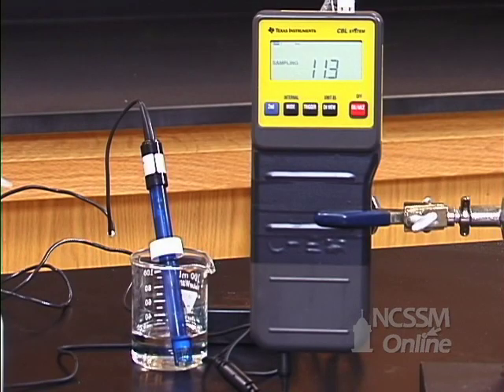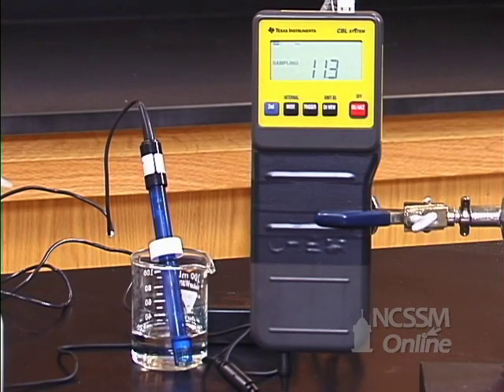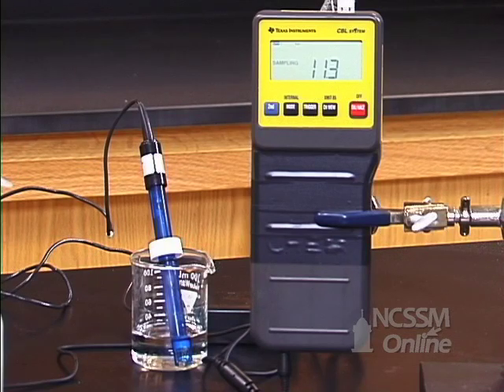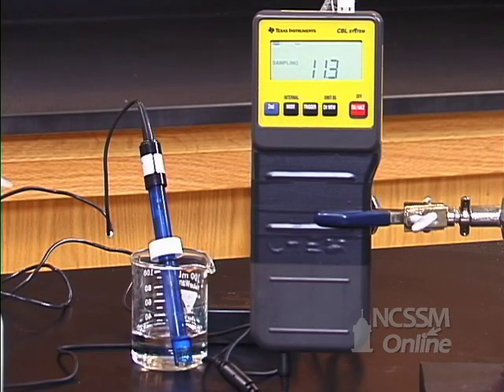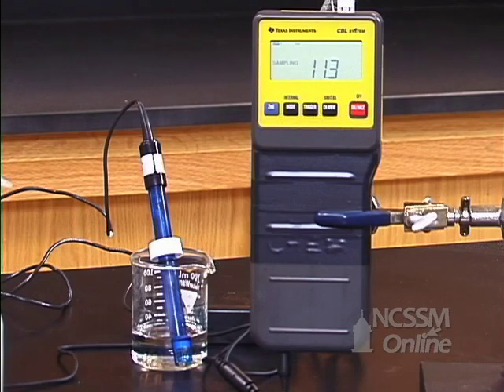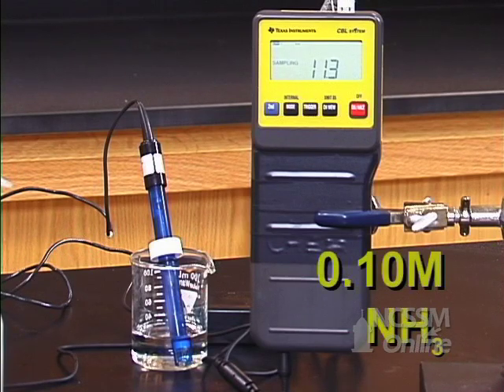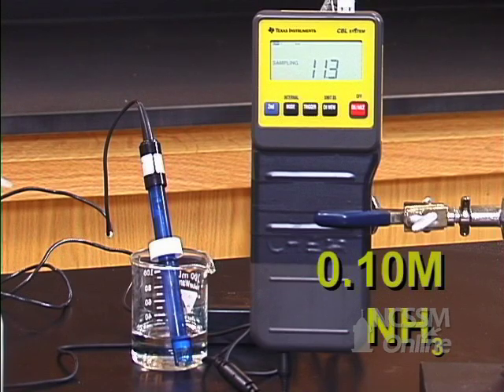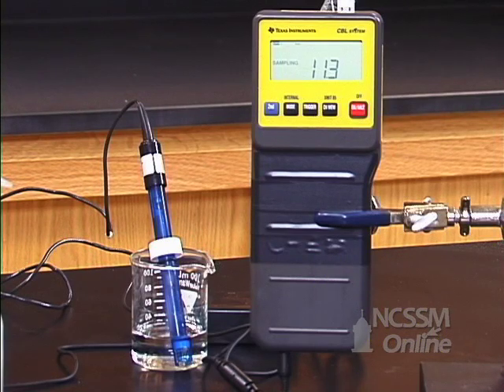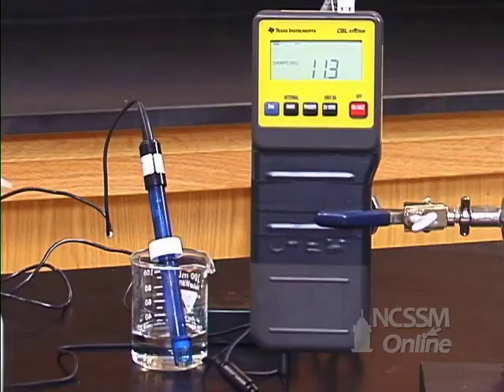You can also make a buffer from a weak base and its conjugate acid. For reference, I have a 0.1 molar solution of ammonia, a weak base. We can see the starting pH is about 11.3 for just the weak base.